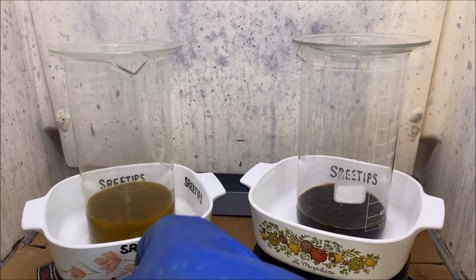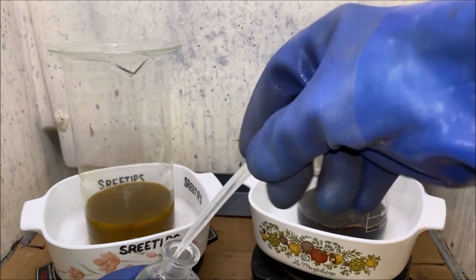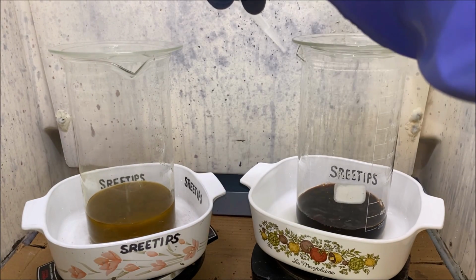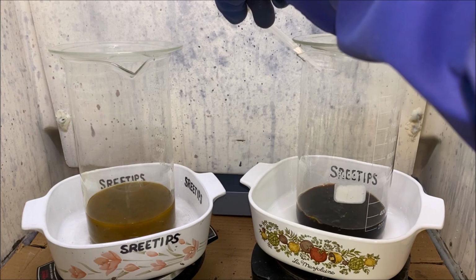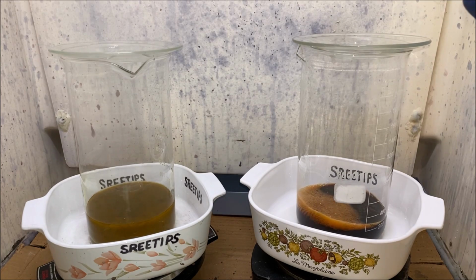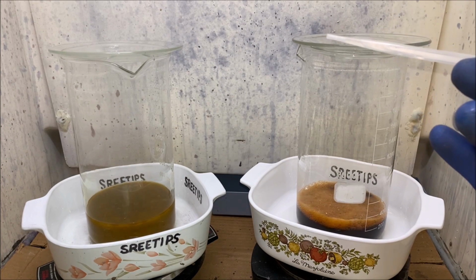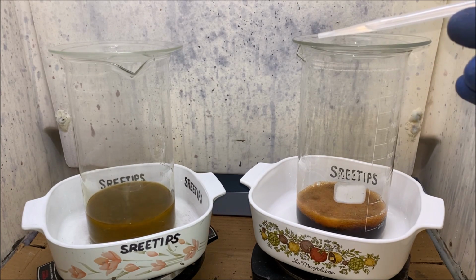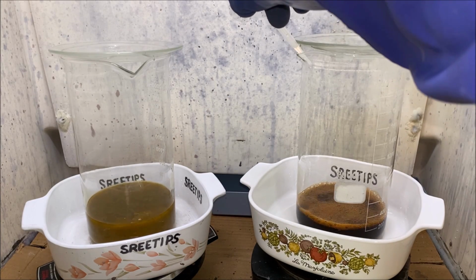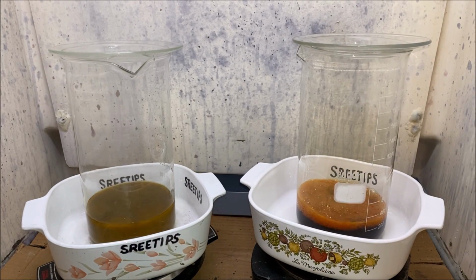Now what we'll do is I'm going to add a few drops of nitric acid to this over here, see if we can get the rest of that precipitate to dissolve. I don't know how this is going to react. Oh yeah, look at that. This stuff loves to run away on you when you add nitric to it. I probably got about 5 drops of it in there. I squirted the rest in. Hopefully they don't take off on me.